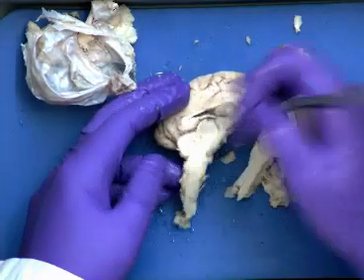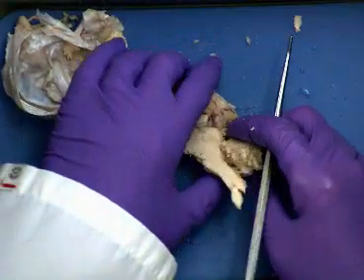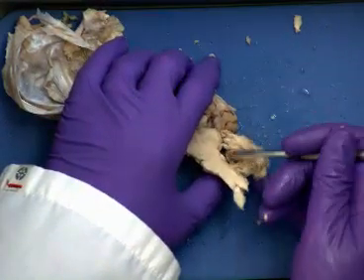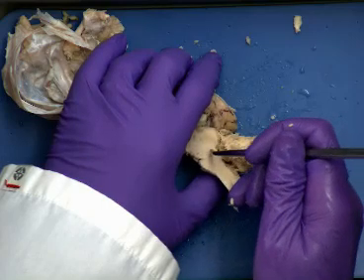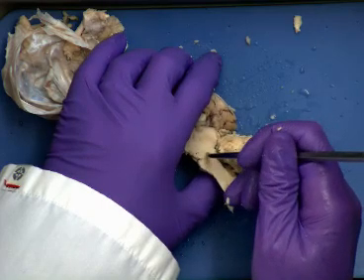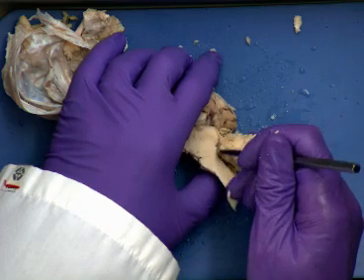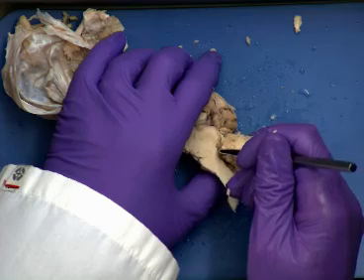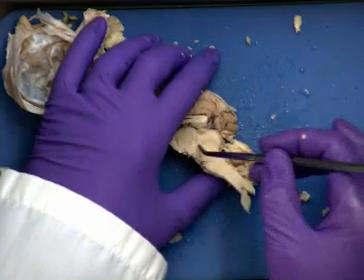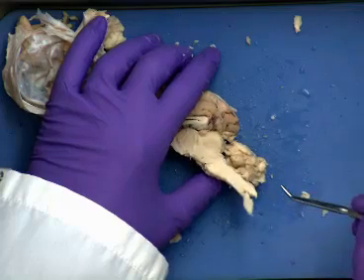Because remember right in here, and again, mine was kind of falling apart, there's our cerebellum. And the 4th ventricle occurs between the cerebellum here and what we see as the rest of the brainstem, like where our medulla is and our pons. So this area right here is going to be our 4th ventricle. You can see there's a little indentation there. That space right there would be our 4th ventricle. And sometimes you can get the cerebral aqueduct, you'll be able to see a groove leading down to that.